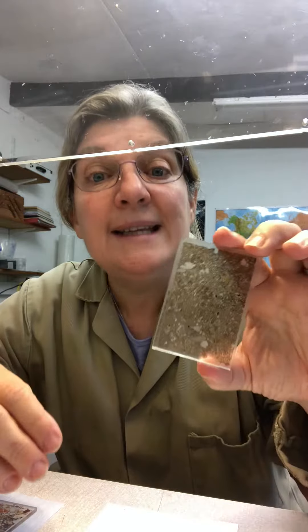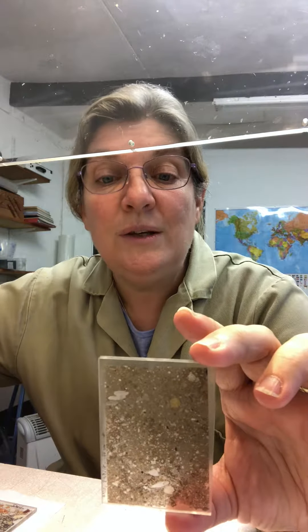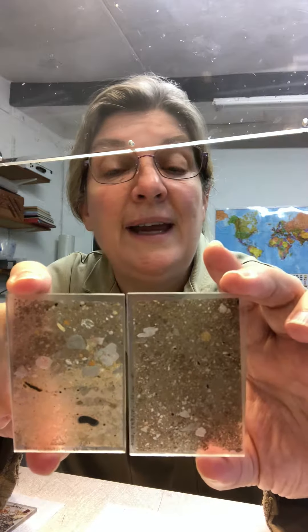Remember that our glass is 1.75 on the micrometer, 2.75 in reality. What we did is we said, okay, 1.75, we're going to add 30 micron — we'll set our stop or our mark to look for at 1.78. And what happened was with the good set of our lovely silty or sandy silt samples is that they ran down to 1.85 and looked lovely.